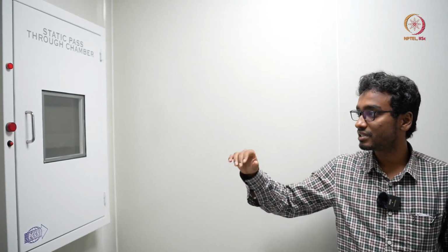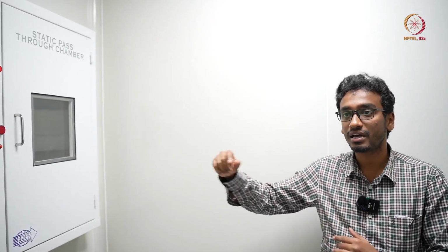So in this module we have discussed the fundamental things about clean room, how to define clean room, what type of clean rooms we have, then what is the usage of this pass box, how she put it once from this side and took it from the other side, not directly taking the samples inside, and then how she gowned, like wearing all the PPE in a particular order. Then she took the samples from that side and went till the hood for the next chemical process. So we have seen these things today, why this sticky mat is used, why these type of PPE kits are required. All these things we have discussed.